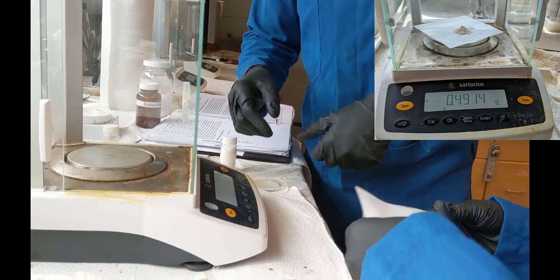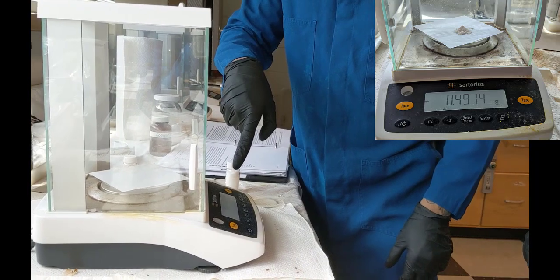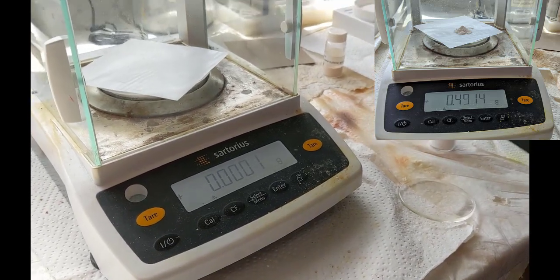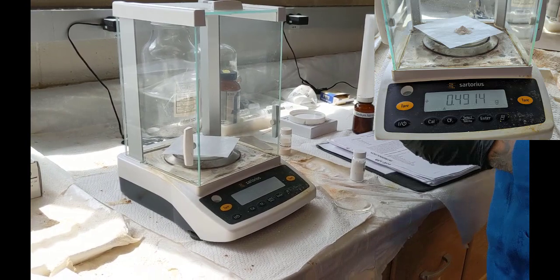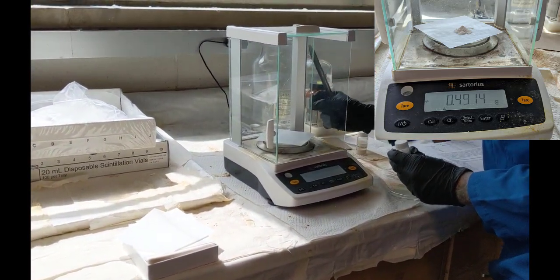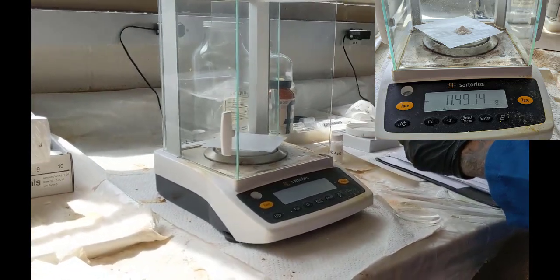And so here we see the TAs are preparing to weigh out 0.4914 grams of aminobenzene sulfonic acid, and this is the para derivative. You can see here in the top right hand corner I have actually given you a screenshot of what the final mass was. So this will be something that comes in handy when it's time to determine your percent yield and theoretical yield.